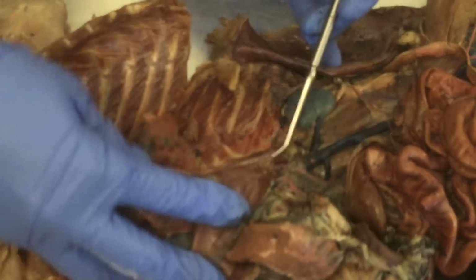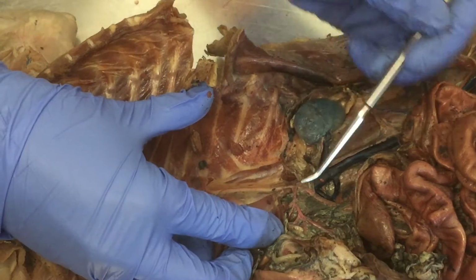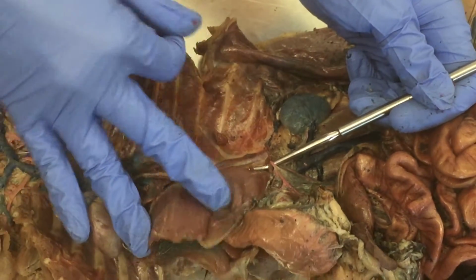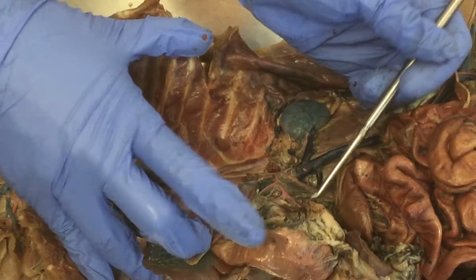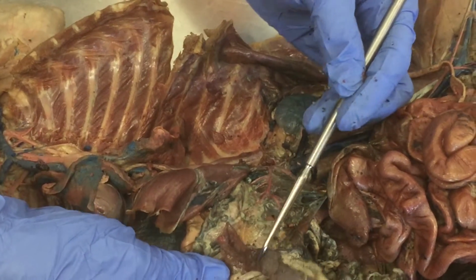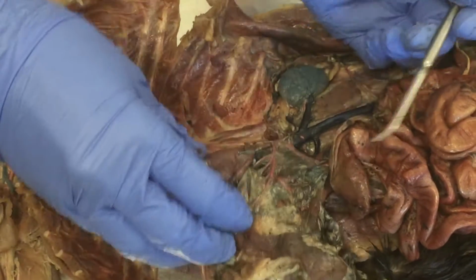And in doing that, then you can start looking at abdominal aorta, and the first branching off of abdominal aorta is going to be your celiac trunk. Okay. Celiac trunk has the 3 branches, and the easiest one to find that goes to the spleen, which is a big dark structure here. Okay, very small on this cat. The spleens on cats can tend to be large.